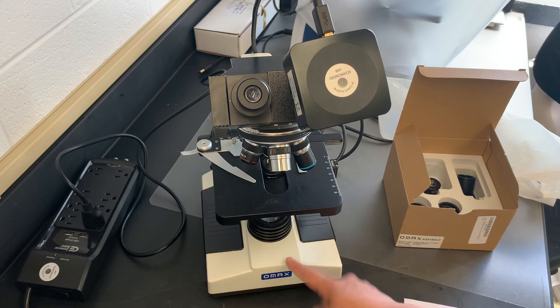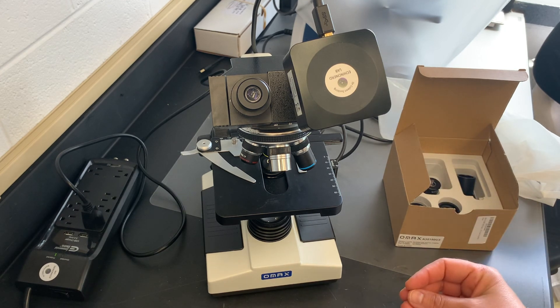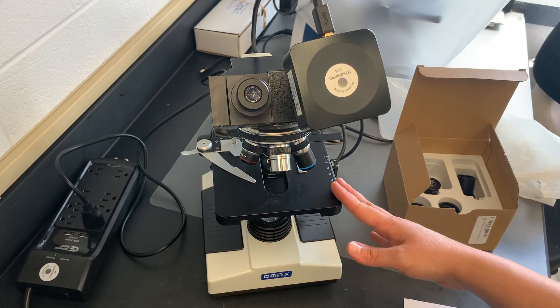Leaving the light on can also make the microscope unnecessarily hot, which is not good when you're dealing with live samples. So make sure the light is always switched off when not in use, and that the cover is back on the microscope. That's just good general working practice to make sure you look after your scope well.